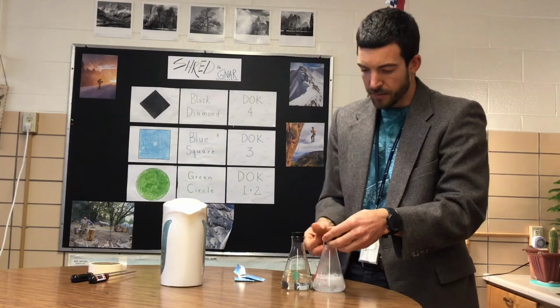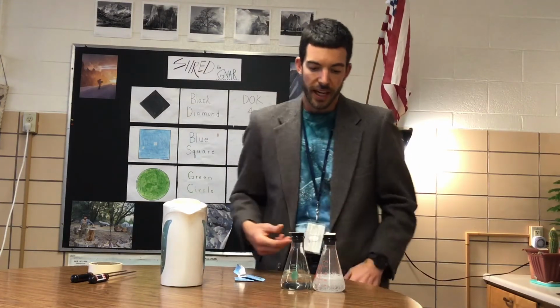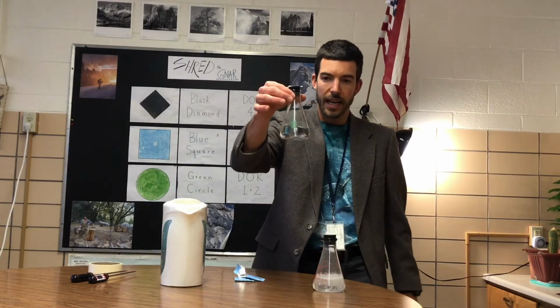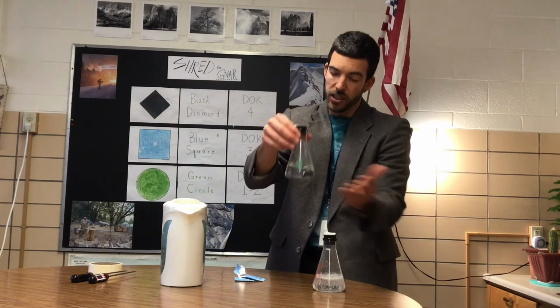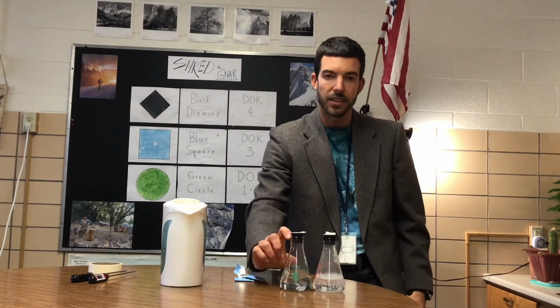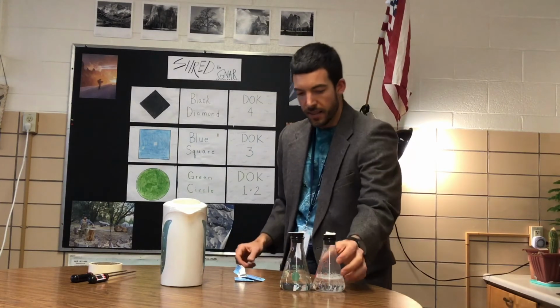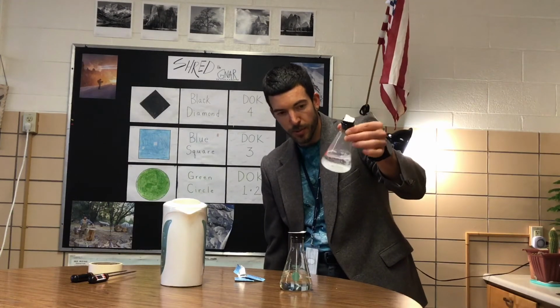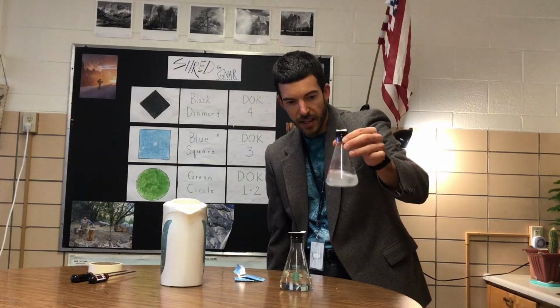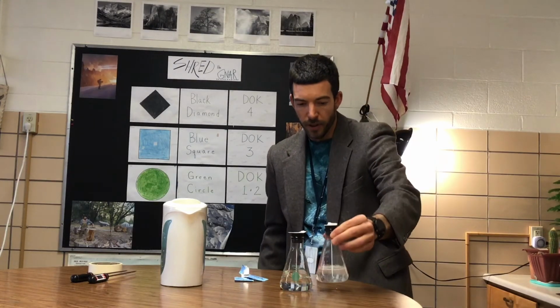I'm going to place a piece of masking tape here on the top of the stopper of both of them so that air cannot escape or enter. Now, this one just has the air of the classroom inside of it, so this is going to be our control. This is what it normally is like. Now, I could do a new experiment and add one that just has oxygen in it, but for the ease of the experiment, I'm just going to leave this with our normal air, and this one has the tablet in it, which you can see those bubbles really clearly now. It almost looks like Sprite is in this beaker, and that's just the CO2 that is coming from our tablet.